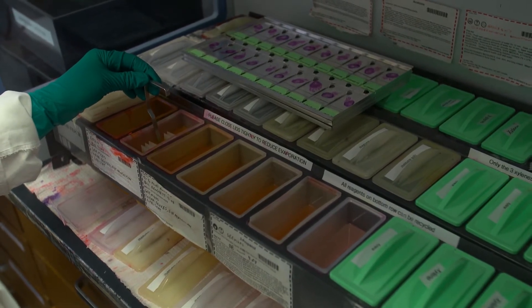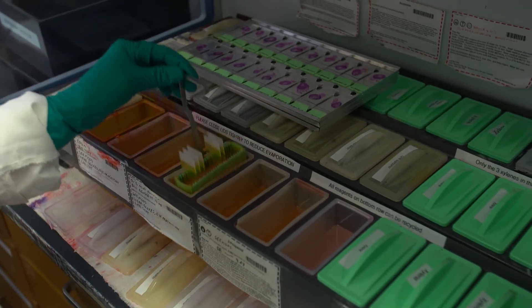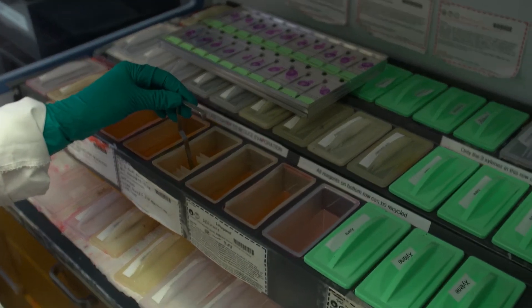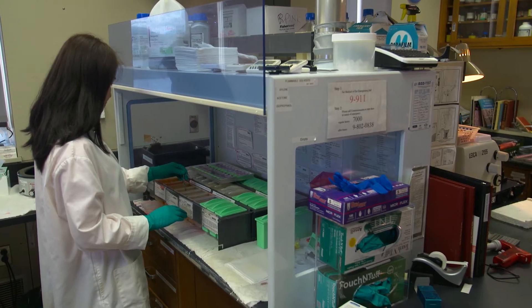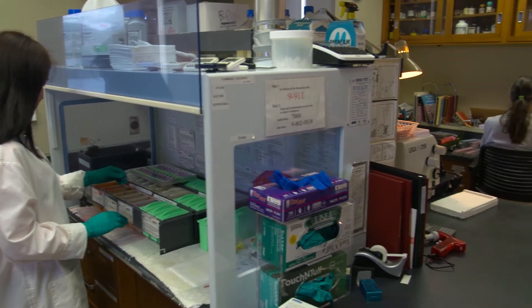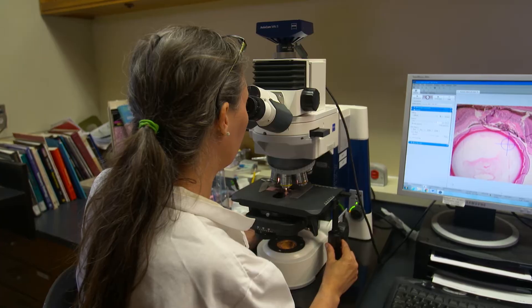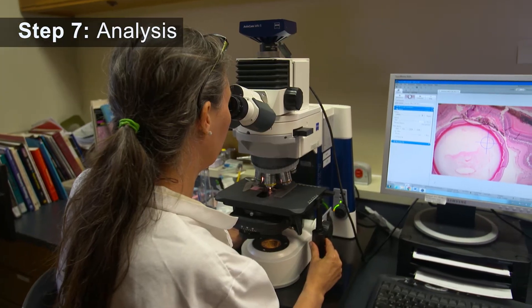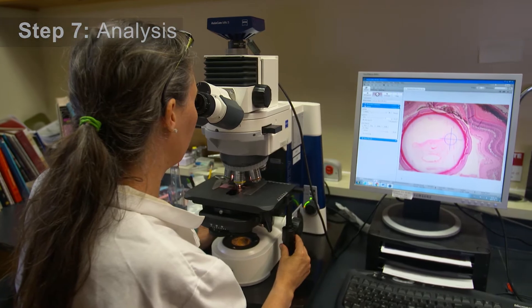The stain reveals features of the sample at a cellular level. The slide is now ready for analysis. Compound microscopes are used to magnify the stained tissue cells.